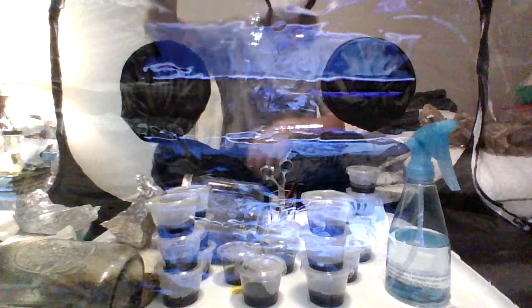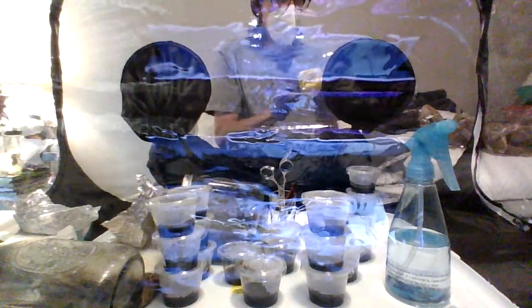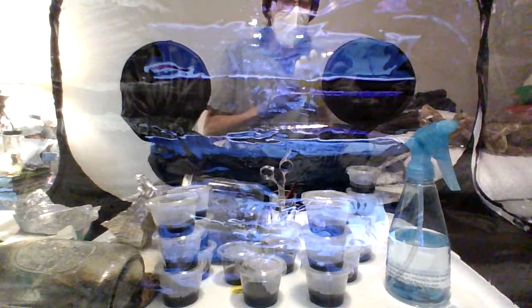All right, so the method we're going to be doing today is called trenching. Like I said, it's kind of self-explanatory, but I am going to explain the process as I go through. I have two different tools here. One for doing the trenching and one for grabbing the contaminated sample from the agar. That way one can just be contaminated. I have my shot glass of rubbing alcohol. I have a clean microfiber cloth in there also that's damp with rubbing alcohol. All this stuff will be utilized. You'll see.